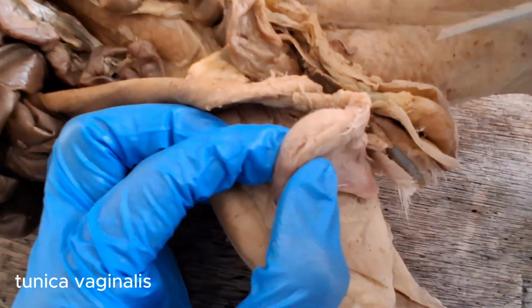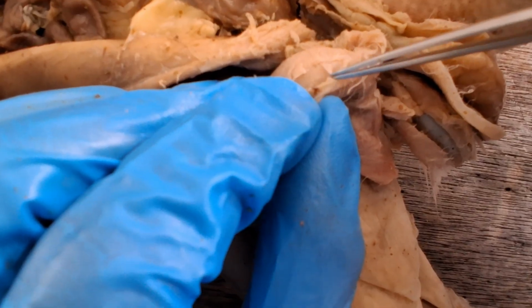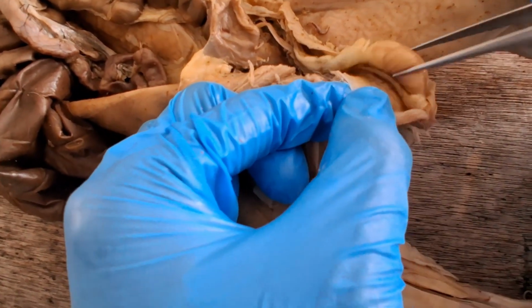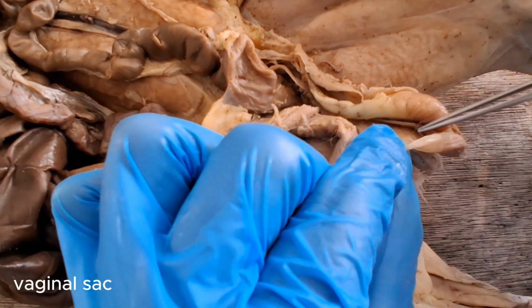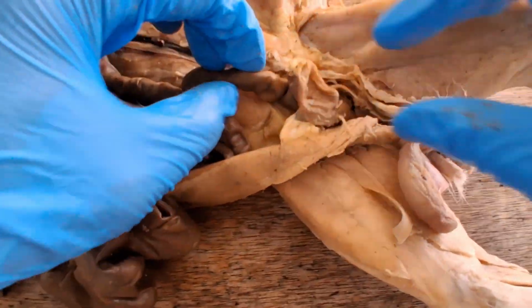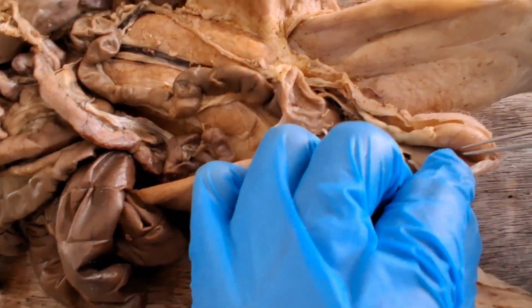So before you reach the testes, you'll reach the tunica vaginalis first. This one. The skin is the scrotum. And the cavity where the testes are located is the vaginal sac. Embryologically, the vaginal sac is derived as an out-pocketing of the abdominal cavity. So this is the vaginal sac.